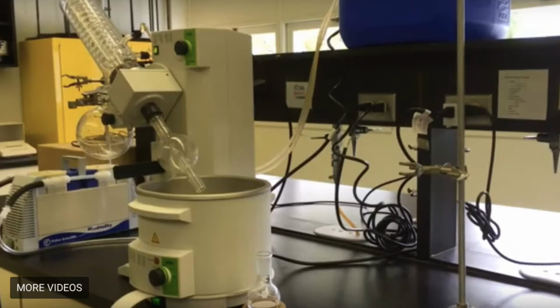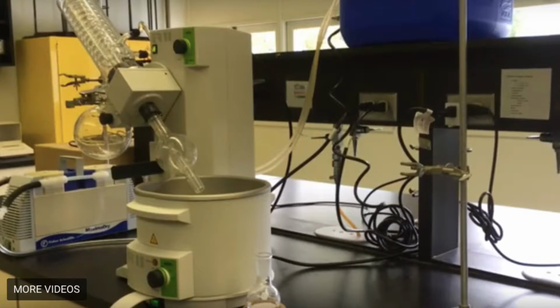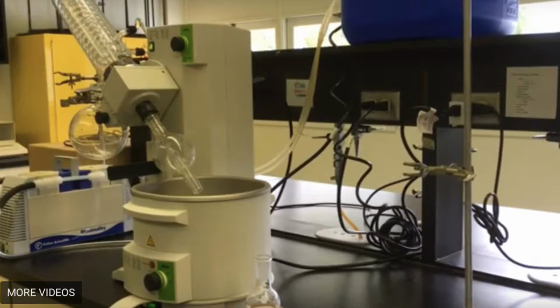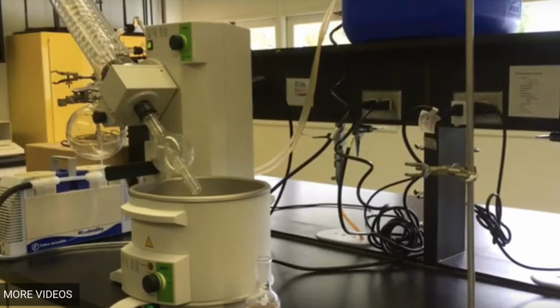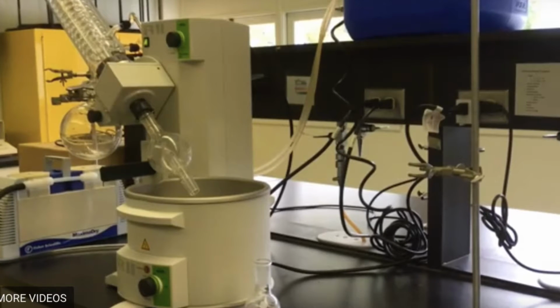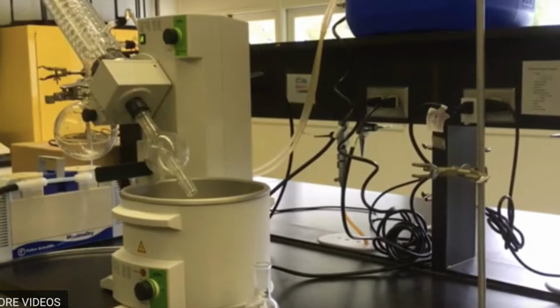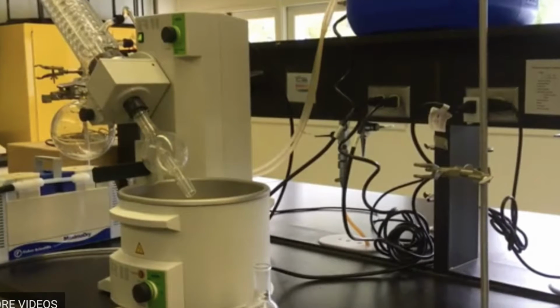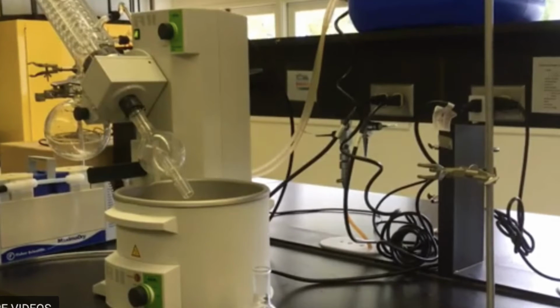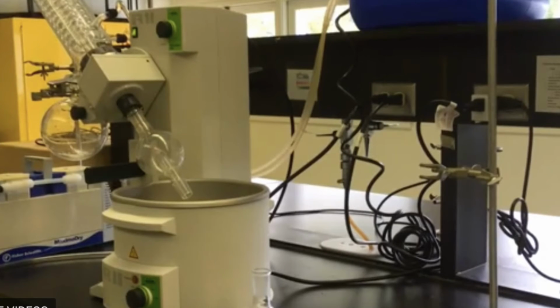Using rotary evaporation to isolate the neutral compound from the organic solvent is better than using simple evaporation or distillation. This is because it is faster due to the lower boiling point from the reduced pressure in the vessel, and because the rotation of the flask spreads the solution around the walls of the flask, increasing surface area for evaporation. Rotary evaporation is also conducted at a lower temperature than simple distillation, which is good for solutes which may not be stable at higher temperatures. When a solvent is removed, rotary evaporation allows for the reuse of this solvent, unlike simple evaporation.